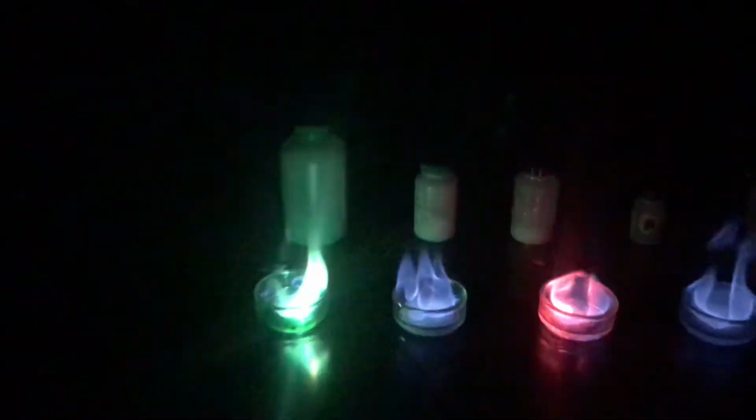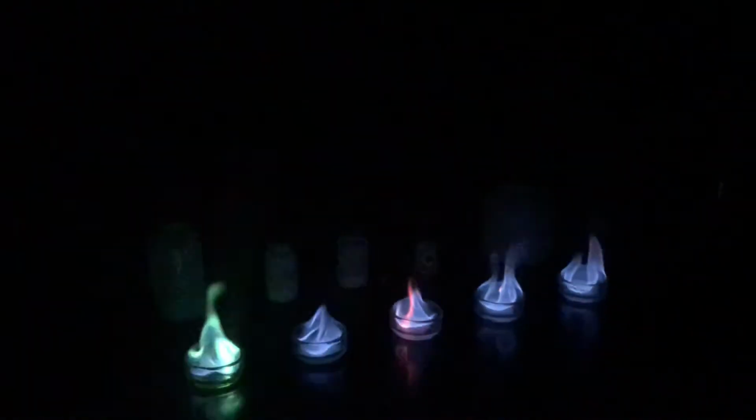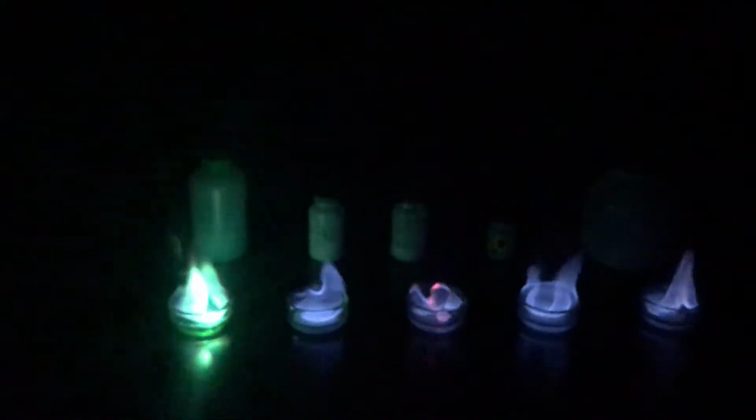Now, some of these you can see right away, and some are going to take a little bit of time for the signature to show up. Remember, we're getting these electrons to bounce around. Obviously, the copper's got a green color. The strontium in the middle has that kind of reddish color, sort of a reddish pink. Okay? As we work on down, the last two look kind of very similar.